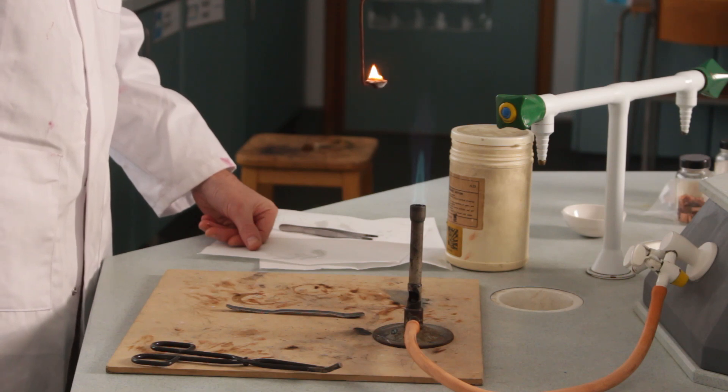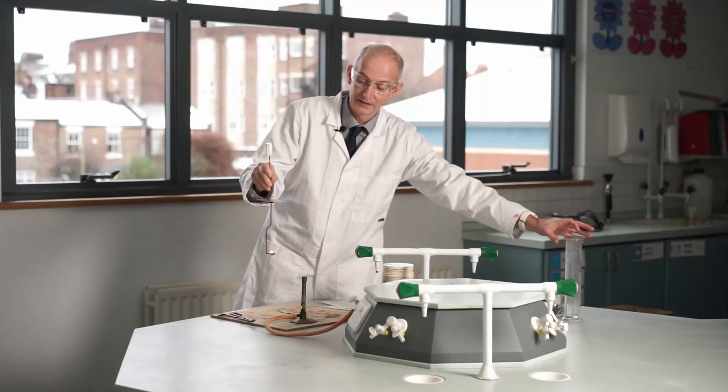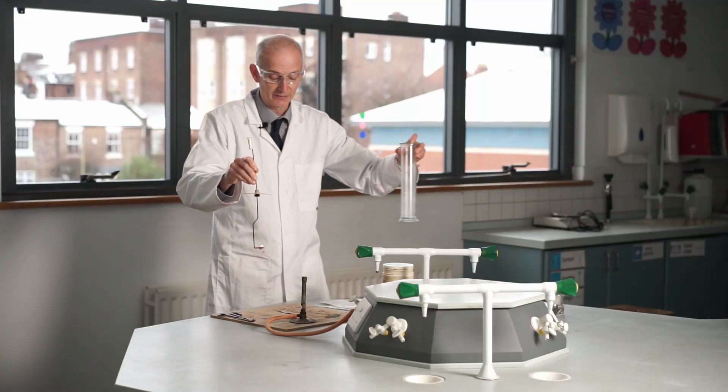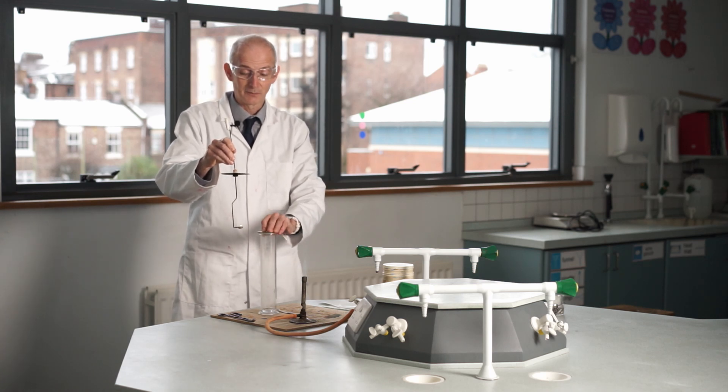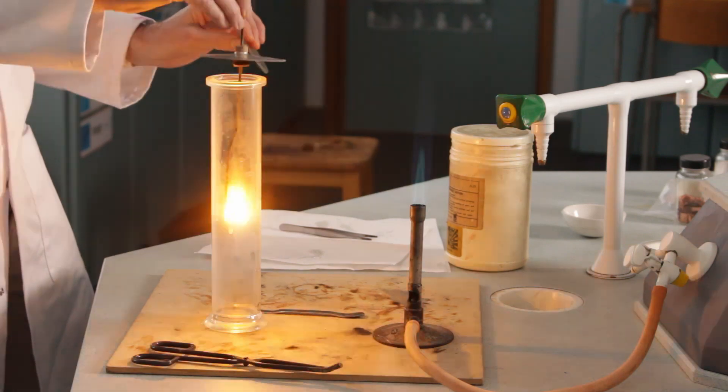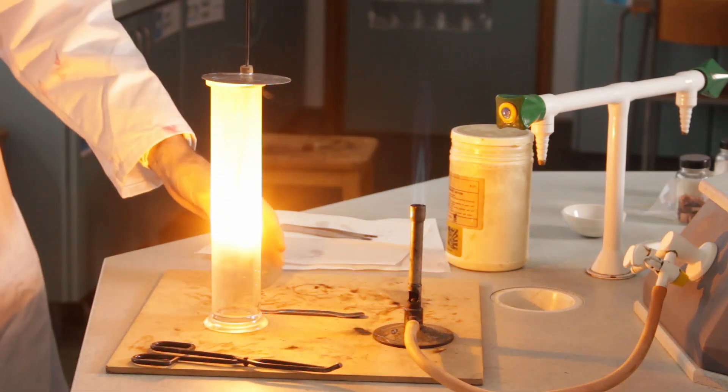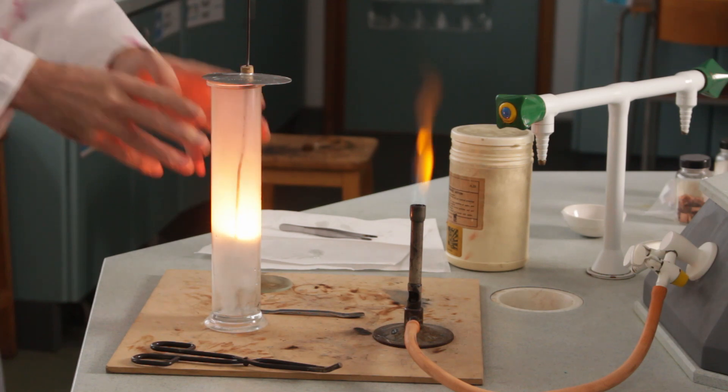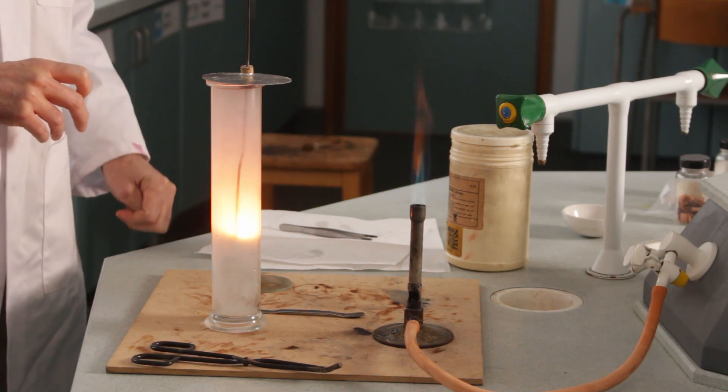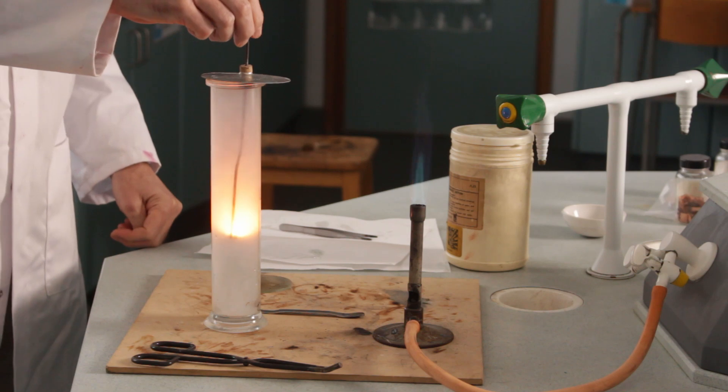It's self-supporting, burning away. I'm going to do something a bit of fun here. I'm going to stick it into pure oxygen and see if that makes things go a bit better. Sometimes it does, so see what happens. Whoa! That's the difference. When it was burning quite happily in air, and then I put it in oxygen—that gas jar there contained neat oxygen—we get a much more vigorous reaction.